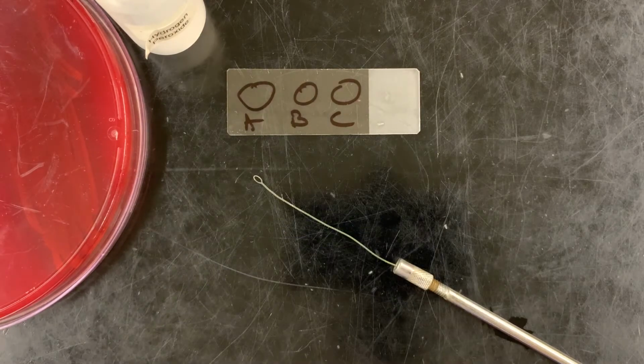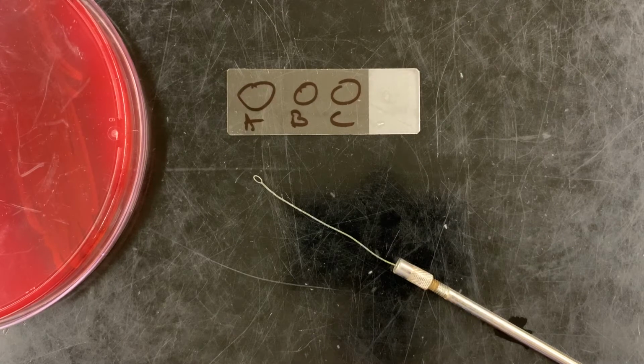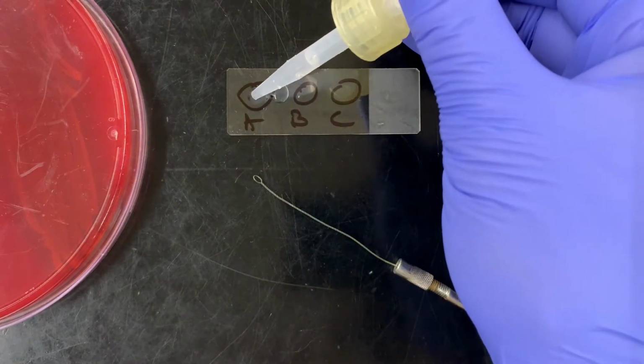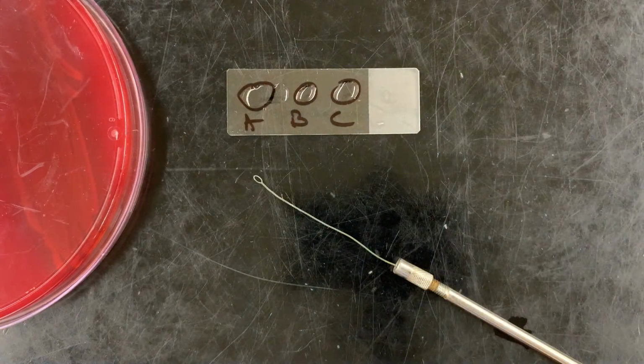I like to use a slide method because it's cheaper and easier and allows us to do this many times. So take a slide, nice and clean, and simply label your samples, with circles marking the approximate area where you're going to drop your samples. We do not need to stay in the circles per se, and today label side up is okay. I like to work on the black table because it provides a nice contrast to our white bubbles. Then you take some hydrogen peroxide and place it within those drops.